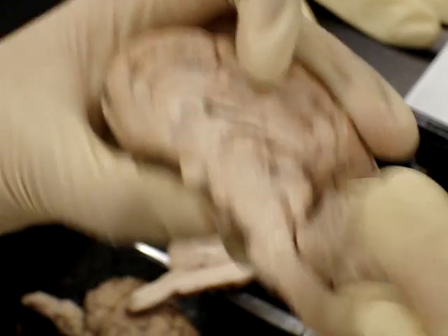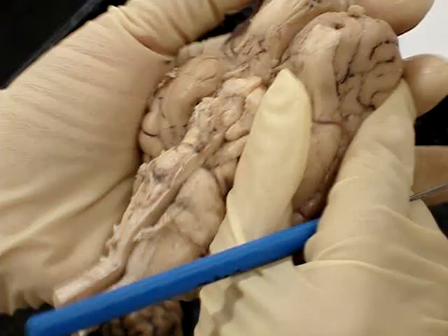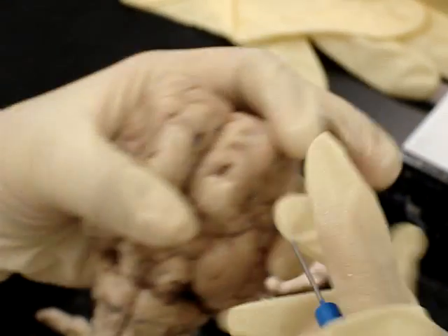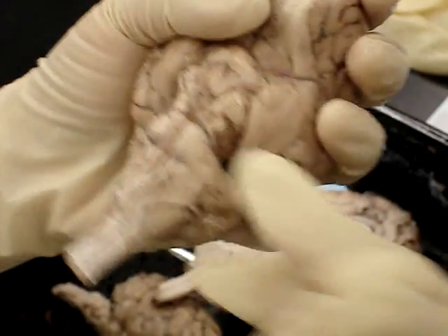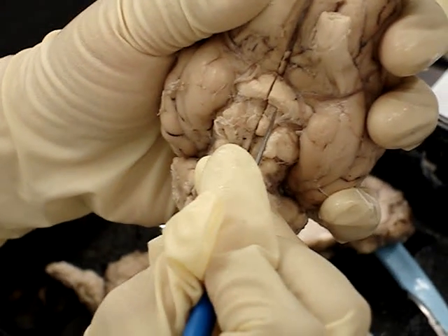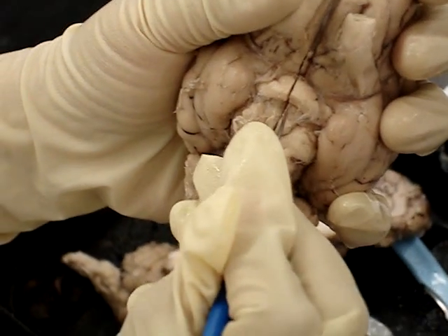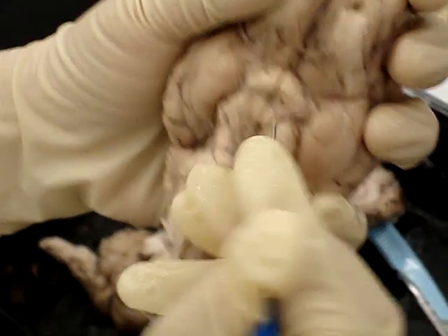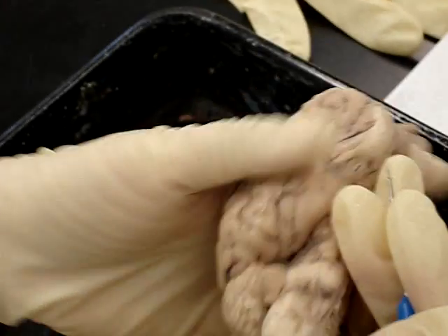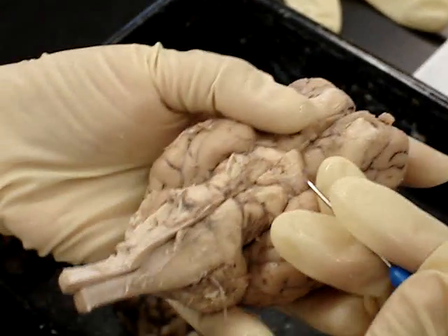The infundibulum — we went through that. It's actually a tube that connects the brain to the pituitary gland, and it sits right below the optic chiasm. If it's easier to remember, the infundibulum is also called the pituitary stalk.